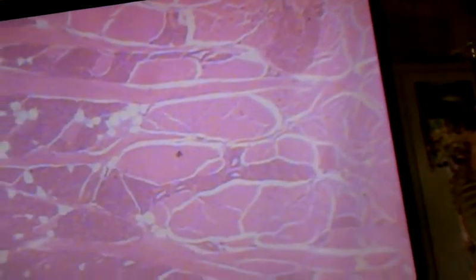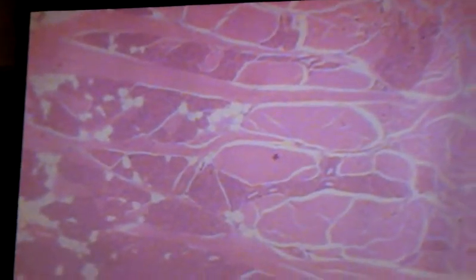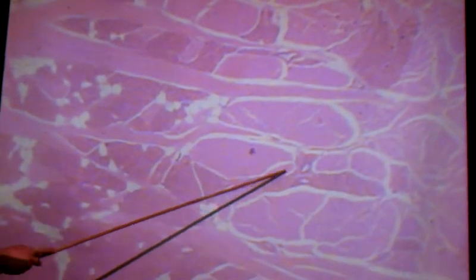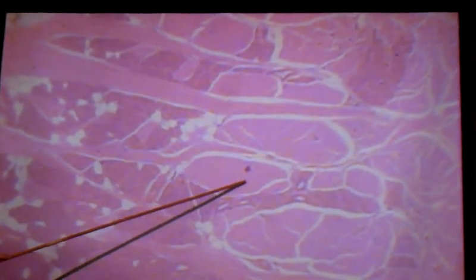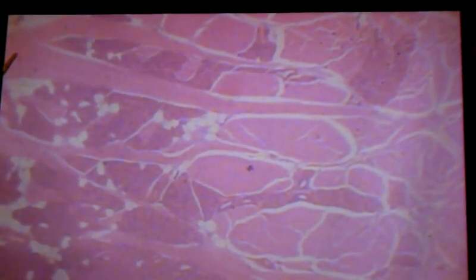What else have we got? Glands or skeletal muscles. So I'm going to come back to low power. I'm going to go deeper into the tongue. I've got several structures here. Most of it is glandular and skeletal muscle mixed together. This is a fascicle of muscle, as is this. This is a fascicle running lengthwise.